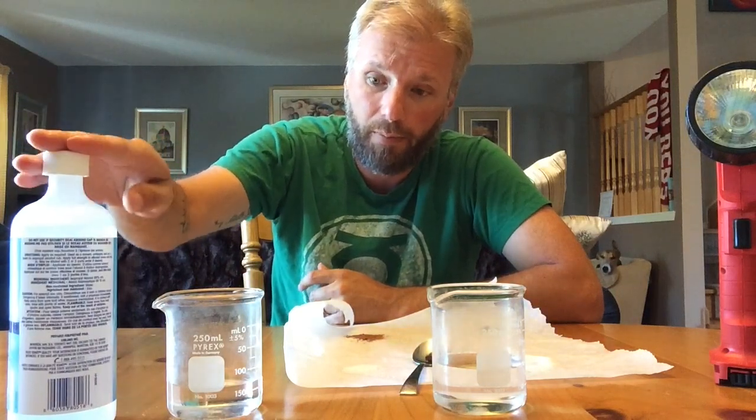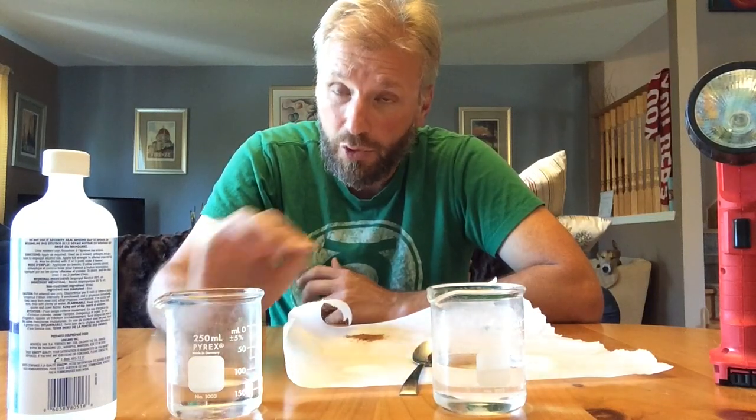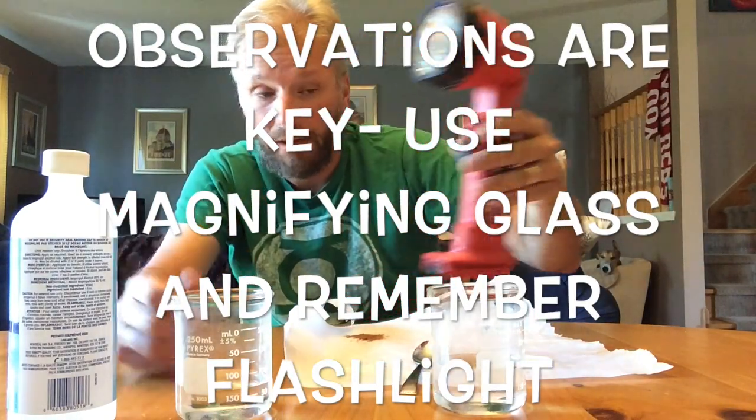All right, and then you come back and repeat. I'll have ethyl alcohol at the back. Again, you don't need a lot, okay? And again, look at the amount of ethyl alcohol you put in compared with the amount of powder you put in. The ratio should be the same. We don't have a lot of ethyl alcohol because you don't need a lot, so you don't have to pour a whole bunch in there. And really observe, use your magnifying glasses. Make sure you bring a flashlight to that experiment, so prepare ahead.